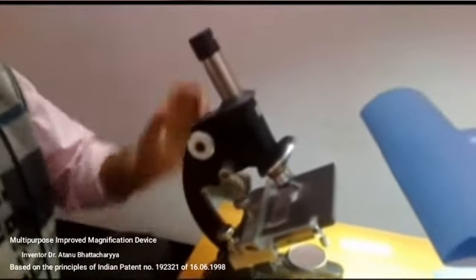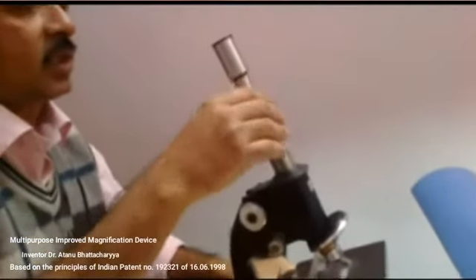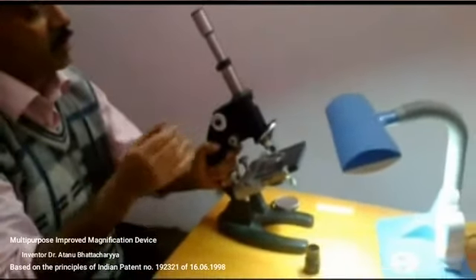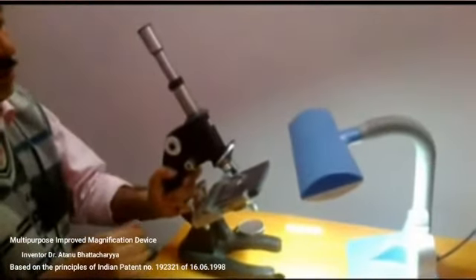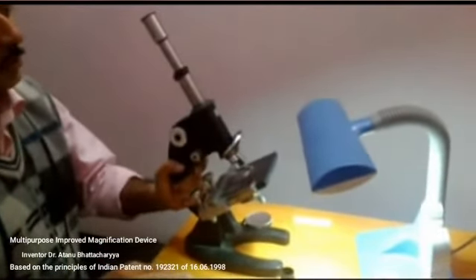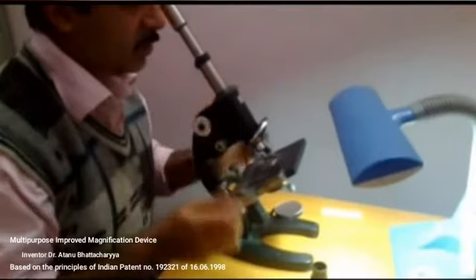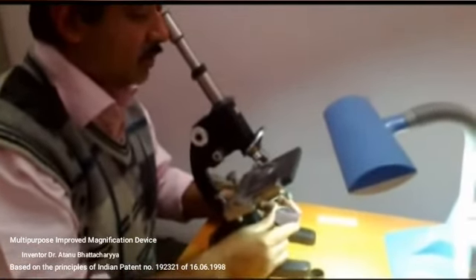During the use of the device, the microscope should be used in an inclined position. This is the inclined position. Actually, the modern microscopes are all inclined microscopes, and it is not very difficult to use an inclined microscope sitting on a chair. But some low height table should be used for using the device. Then the problem will be very less, and by inclining the microscope it can be used easily. So this is the method of using it.